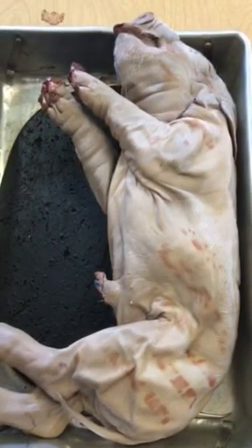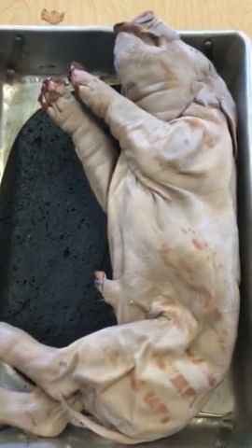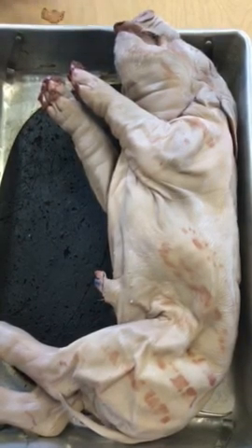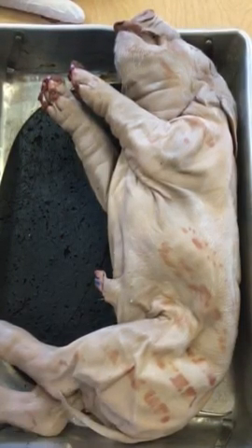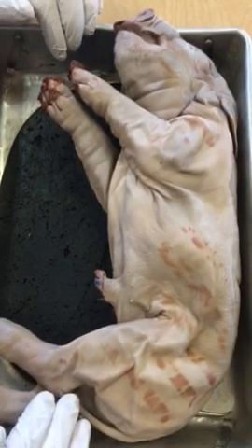I'm going to show you some videos for our pig dissection. You want to make sure that you watch these videos for studying time for the practical. They're going to be set up in 3 different videos. We're going to go over the external anatomy in this video. The second video is going to go over the oral cavity, and then the third video is going to go over the internal anatomy.